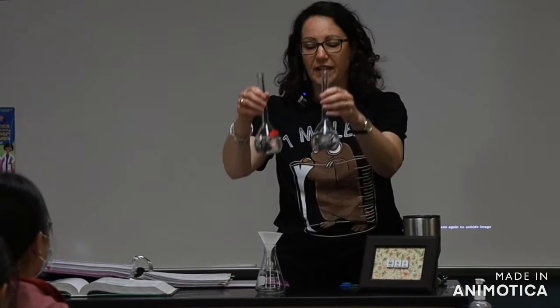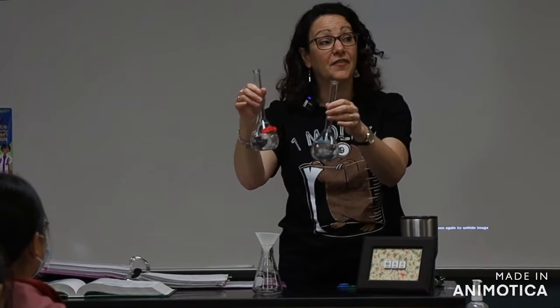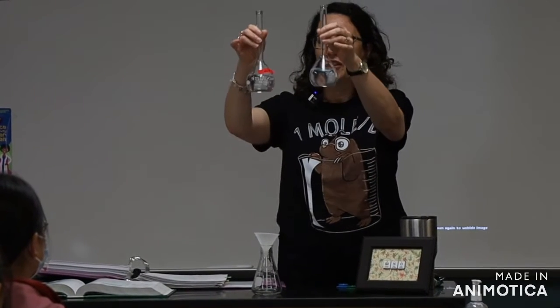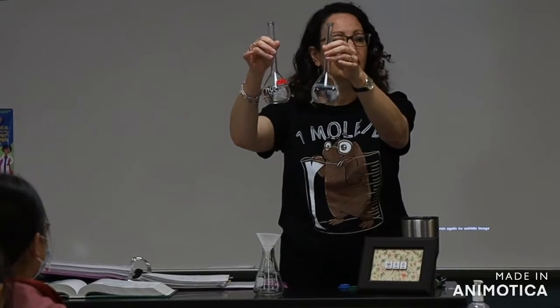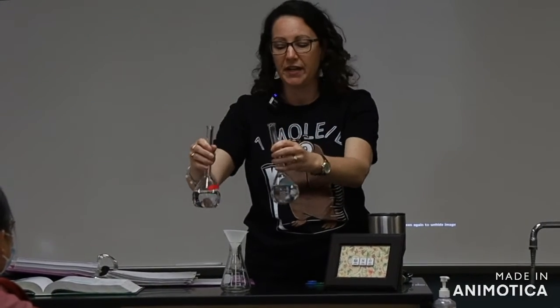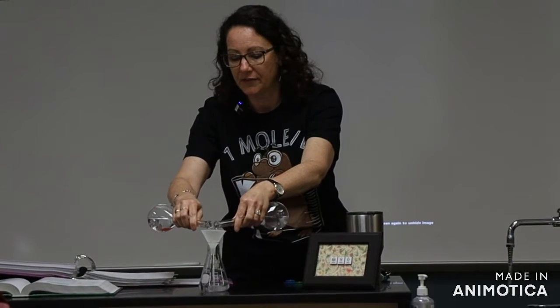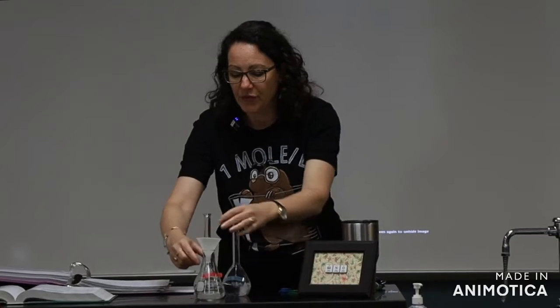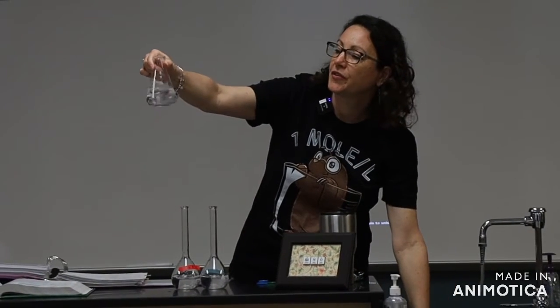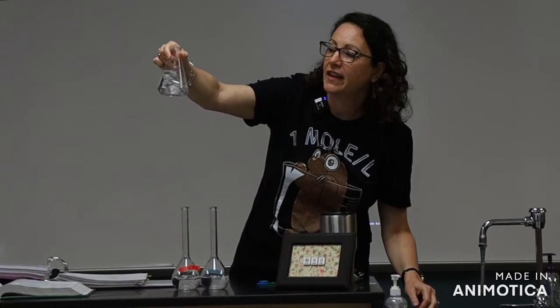And so depending on the concentration of each of my reactants, that affects the rate law, like we learned in the lecture yesterday. So I tried to glug equal amounts. So now I'm going to try to glug unequal amounts, right? So I'm just going to pour in, and this is not being measured, of course. So I'm going to pour in maybe B a little bit faster than A. And we'll see if it changes the time that it took for the reaction. And so again, keep your eye on that.